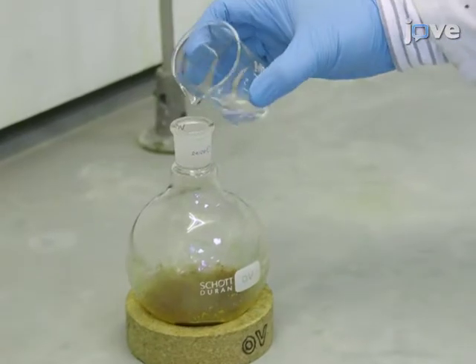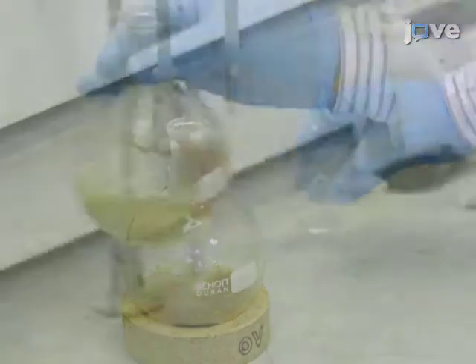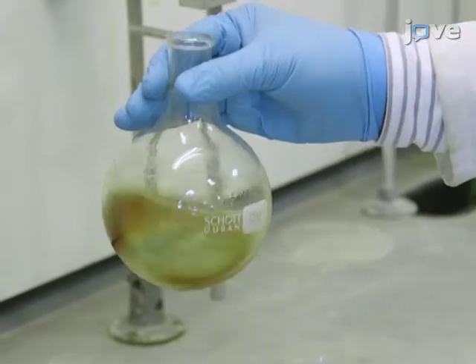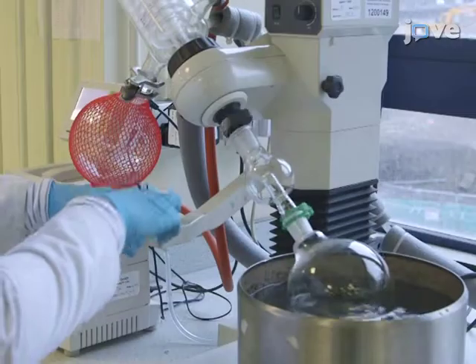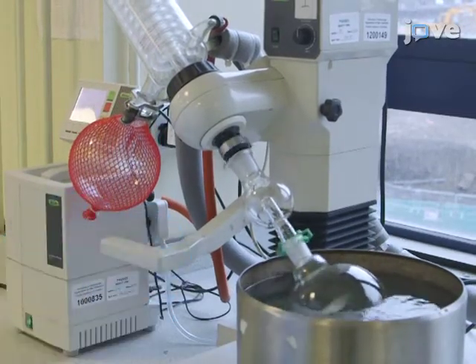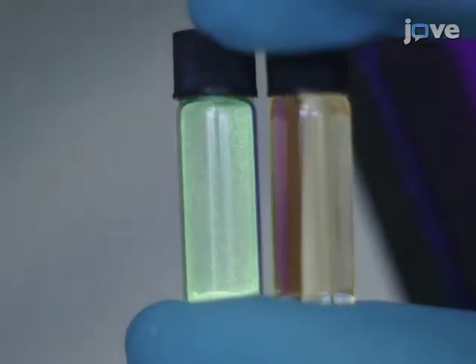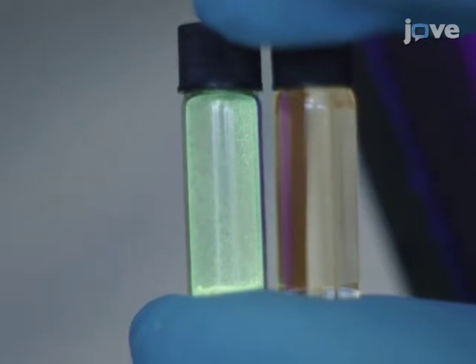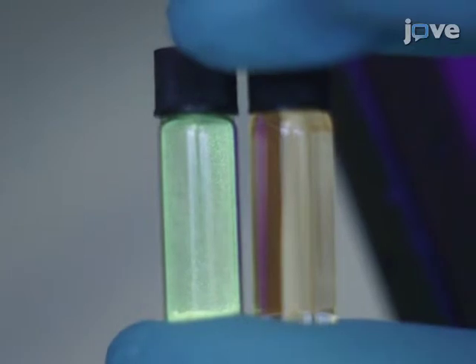and dissolve the crude product in a 2-to-1 mixture by volume of DCM and hexanes. Purify the compound with column chromatography and remove volatiles to obtain compound 5 as a white solid, which glows with a green light under the UV irradiation. Toluene solution has an orange luminescence due to the solvatochromism.